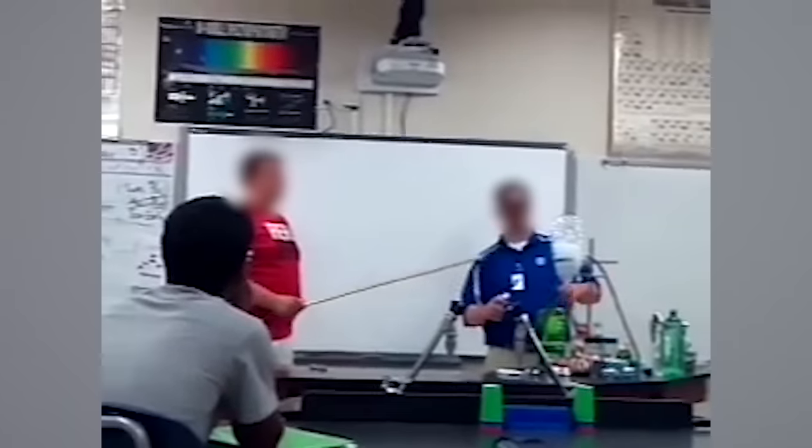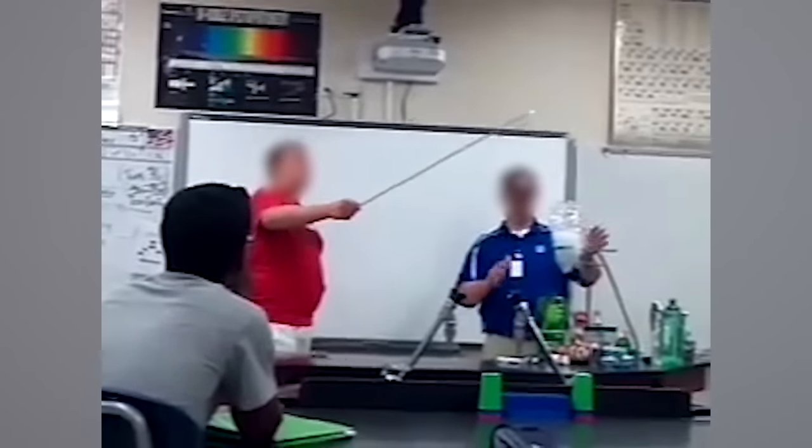Okay, we're in a lab with an actual science teacher, full safety gear, no stunts, no bottle rockets in the face, just good, controlled experimentation. That said, they seem to be setting balls of fire alight just below a sprinkler. Now look, I'm not a scientist, but my gut tells me that's not a good idea. My gut was right. It's a fact that if you put fire near a sprinkler, it goes off.